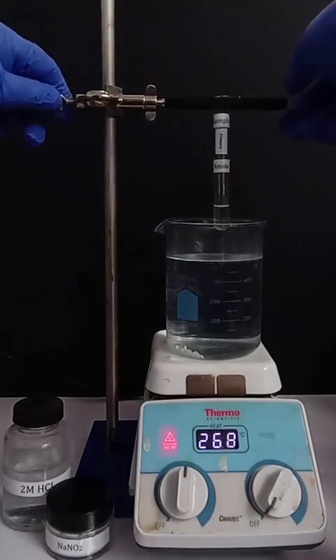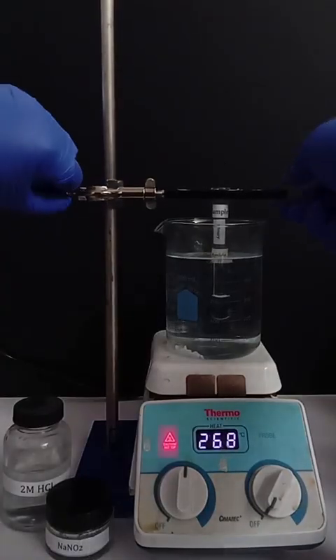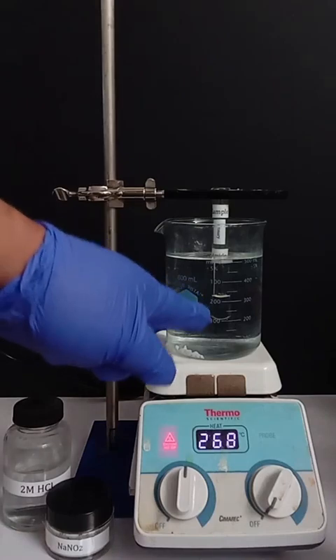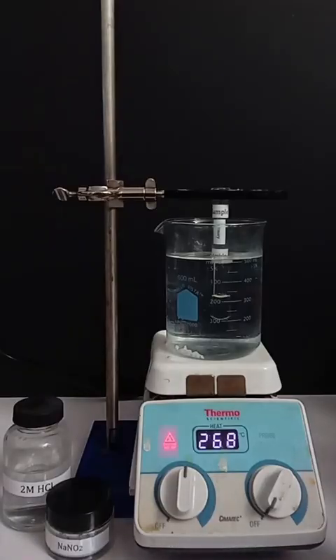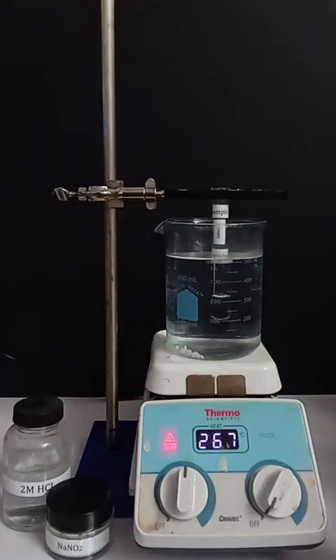For this demonstration, a primary amide test tube is placed into a test tube holder and lowered into a water bath set to about 60 degrees Celsius. Seconds later, a stream of bubbles, or effervescence, indicative of nitrogen gas, becomes visible upon heating. This confirms the presence of a primary amide.